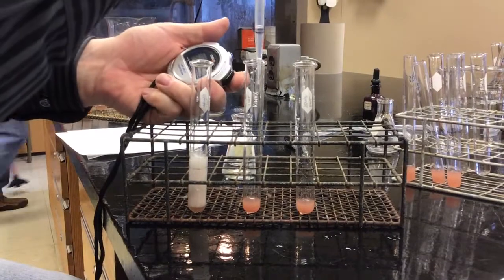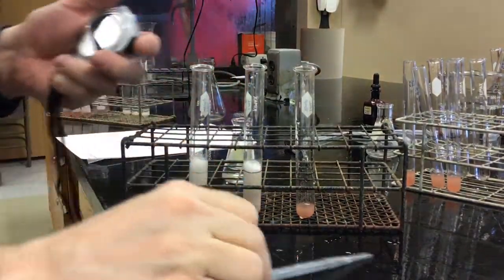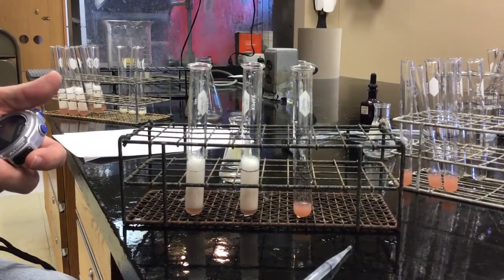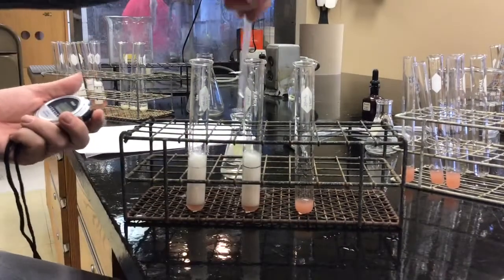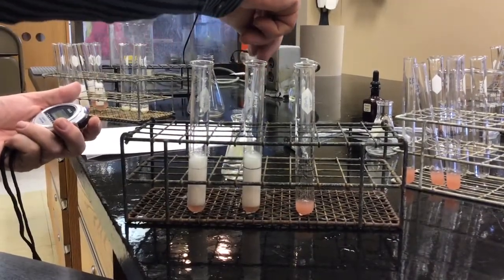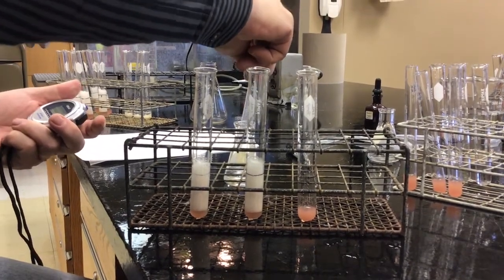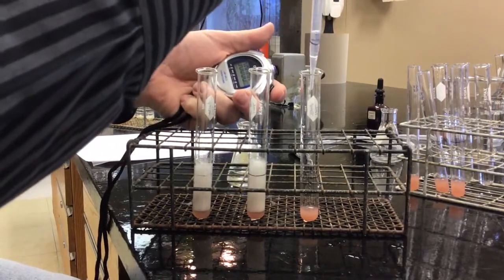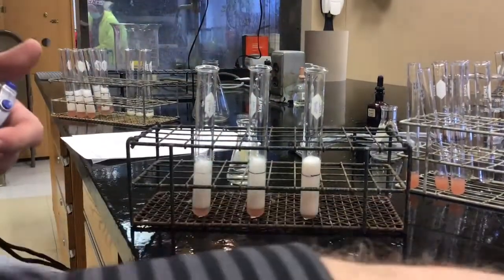Okay, trial number 2. 1.13. And trial number 3. Oops. .15.